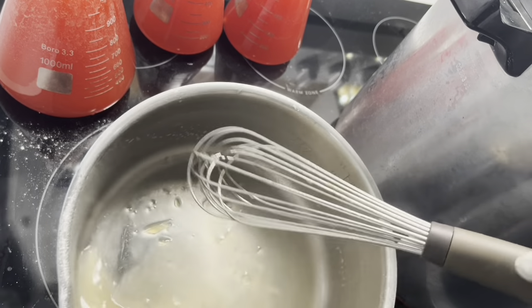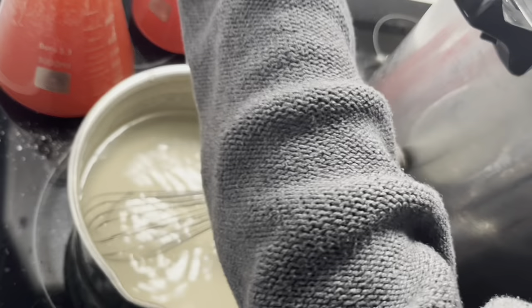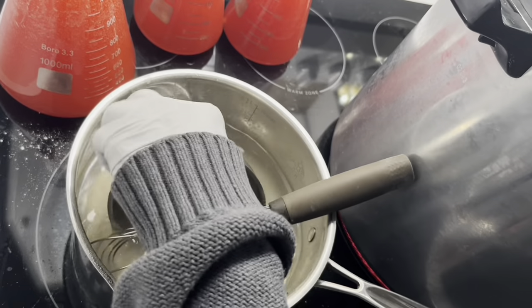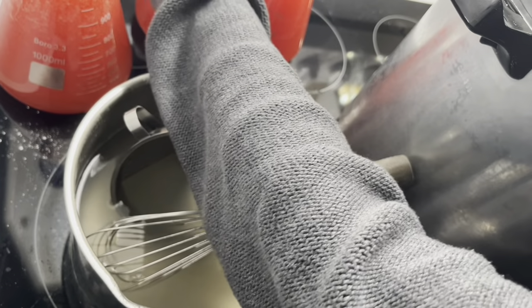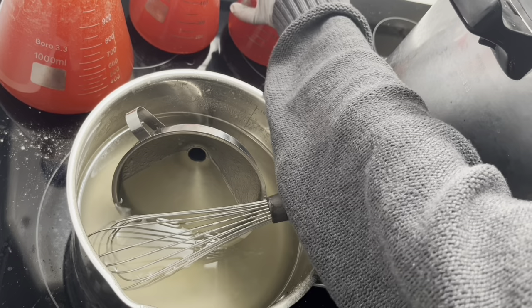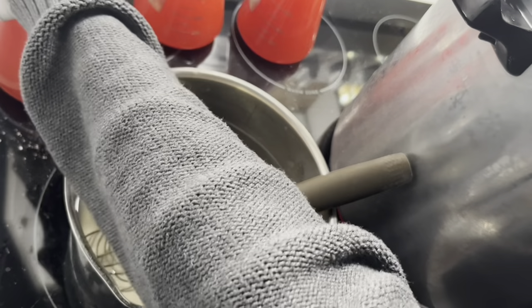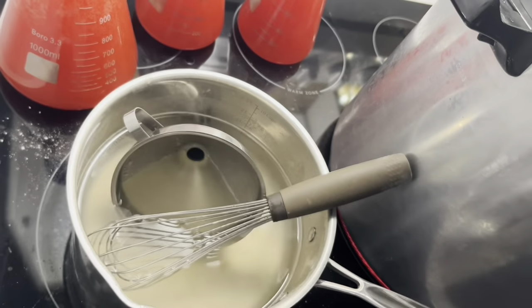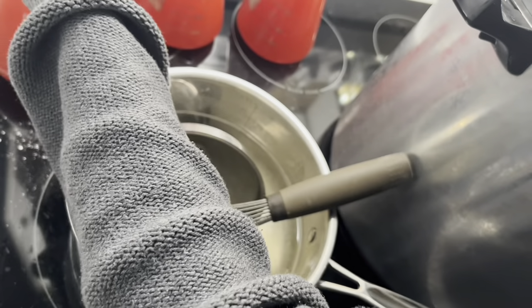Get this in the sink ASAP, get more water in here. I'm going to keep this warm so it washes out easier. Lids on — get our lids on. You just want to tighten it enough: when you meet resistance, you're done. Don't over-tighten it — just close it. Some people say you don't have to use the foil, but I like using it.